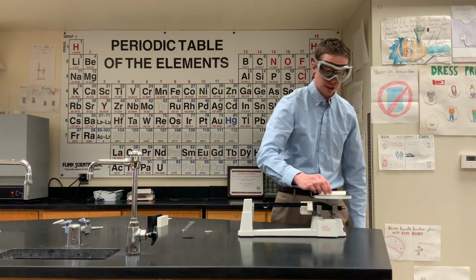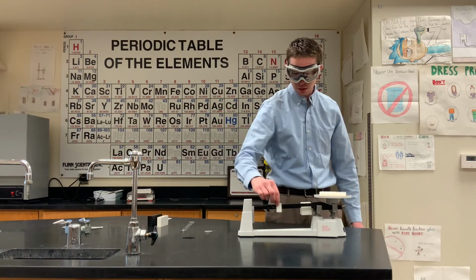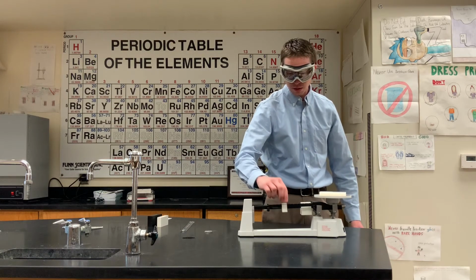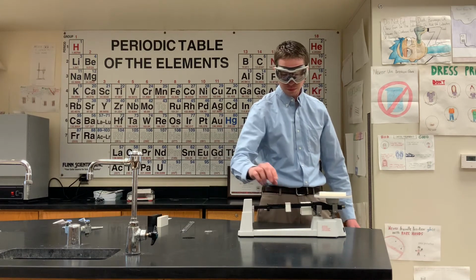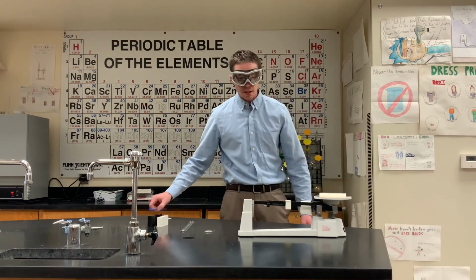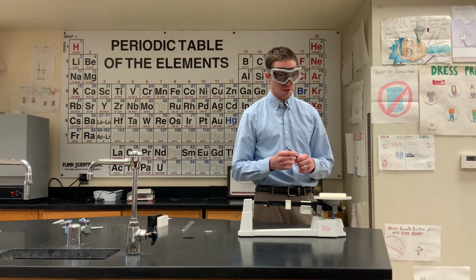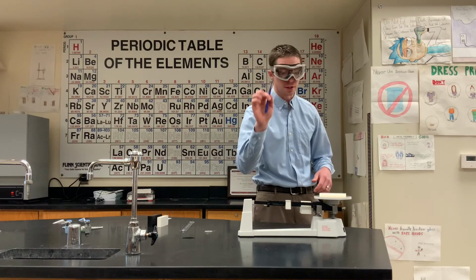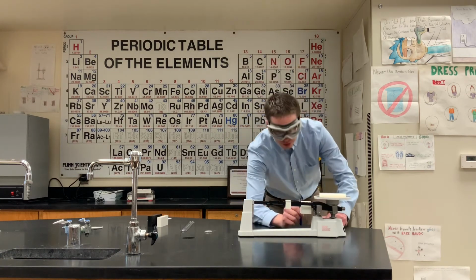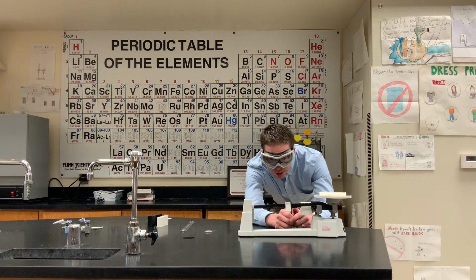Block on the pan here. I'm going to make sure that that's locked in. And then one of the tricks to make sure that this thing is not going to bounce quite so much on you: use a pencil or a pen with a thin end to slide the ones, the lightest rider. And then it's going to bounce a whole lot less on you.